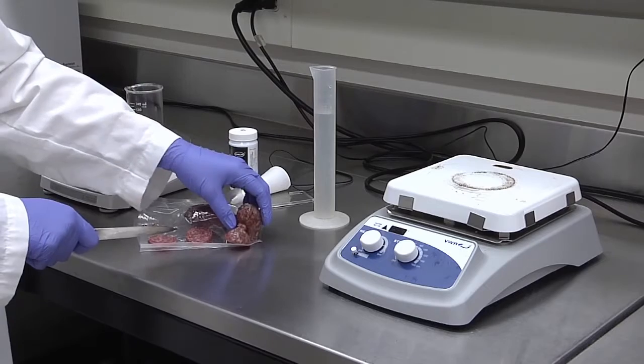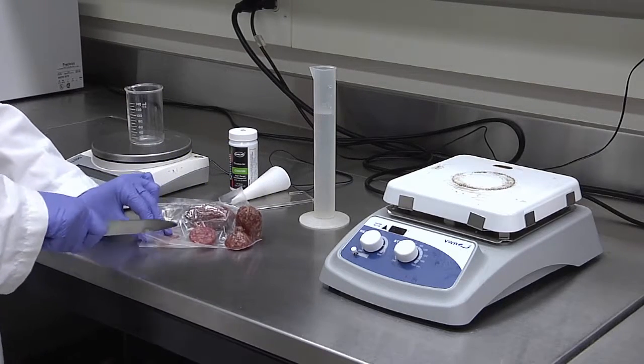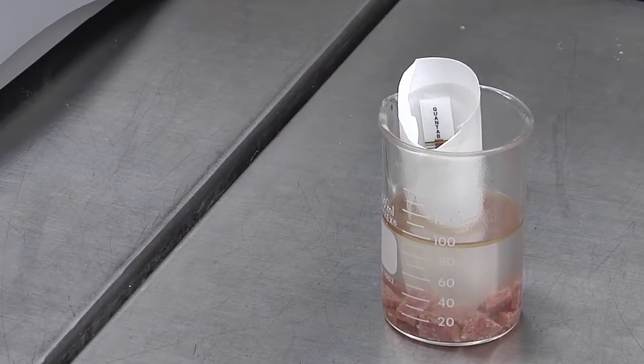If the two tests are quite different, a third sample can be made to see which test may be an outlier and discarded.